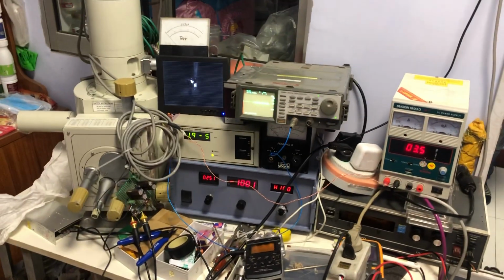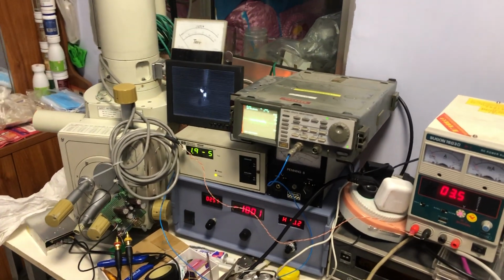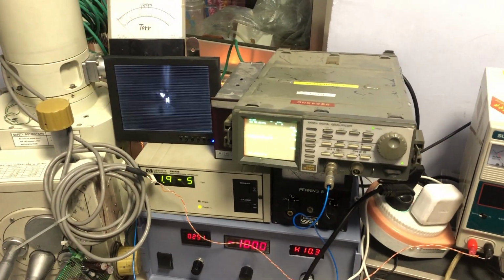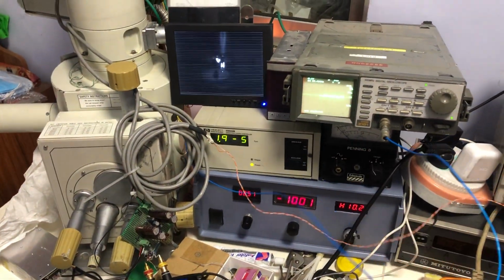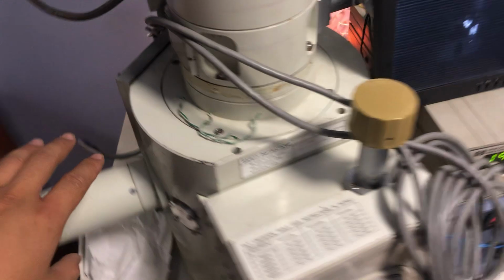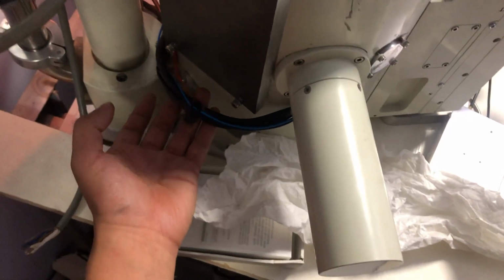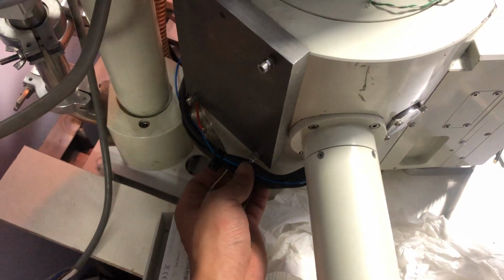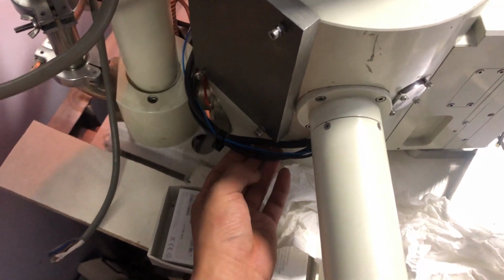Okay, here is the test of the secondary electron detector. Okay, here the blue wire is the output of the detector itself. So you can see here is the secondary electron detector, and here is the wire that has been taken to the detector itself.